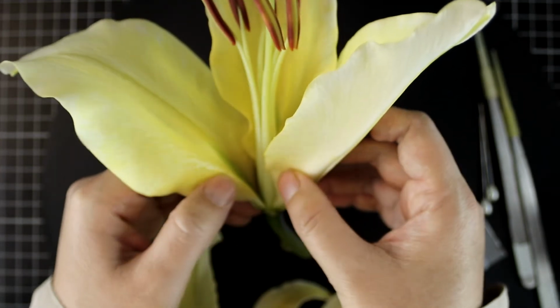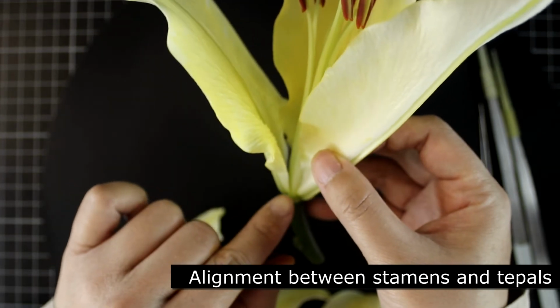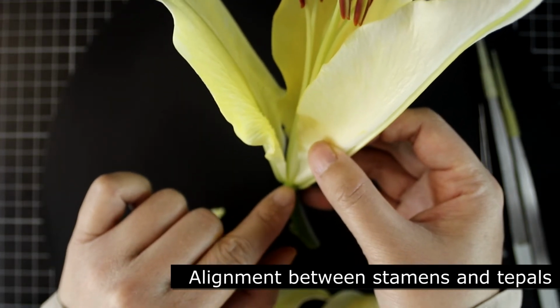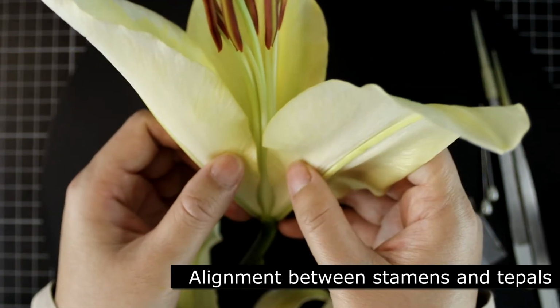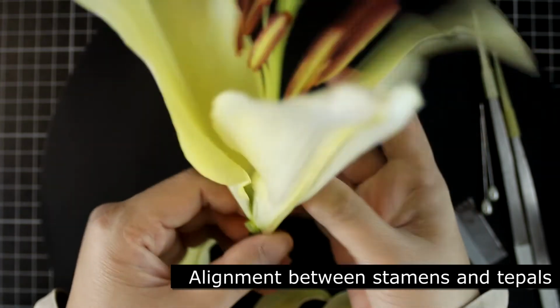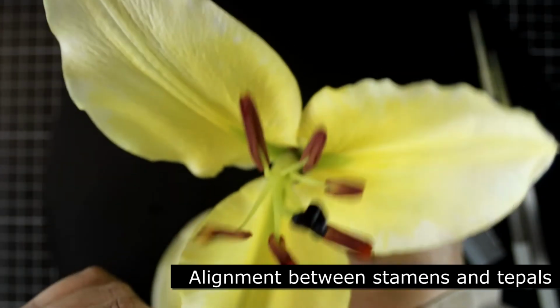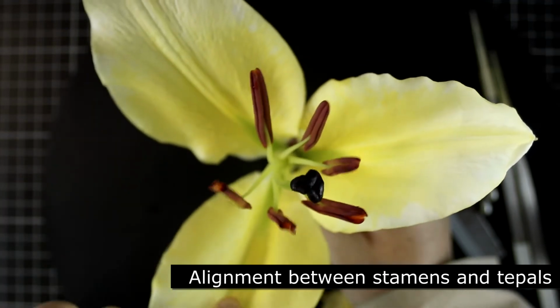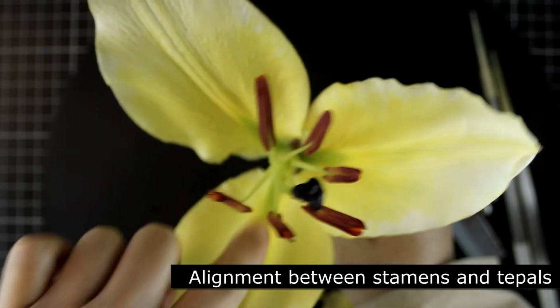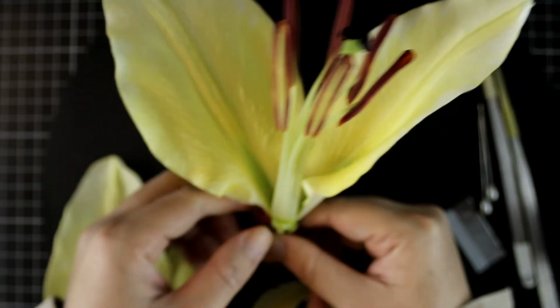Now you can find the stamen as I remove the outermost whorl. And we found that the stamen actually is aligned with the attachment point of the outermost whorl tepal. One here, another here, another here. Okay. And this is the tepal in the inner whorl. And you can find that it is also aligned with another stamen. Okay, now I remove it.